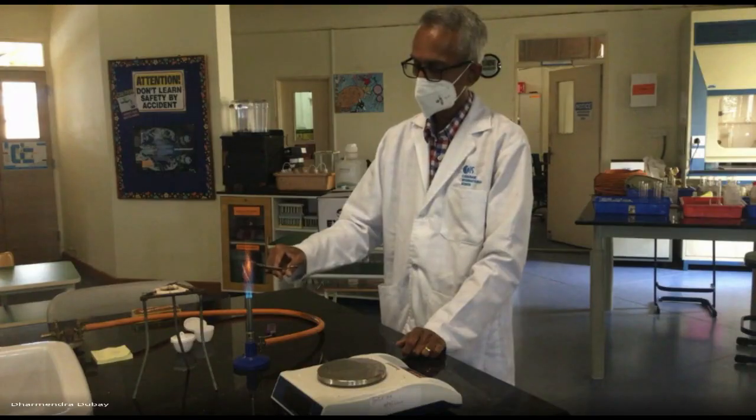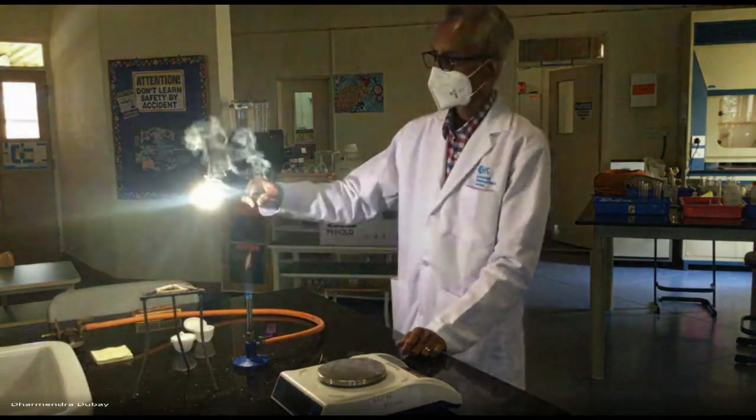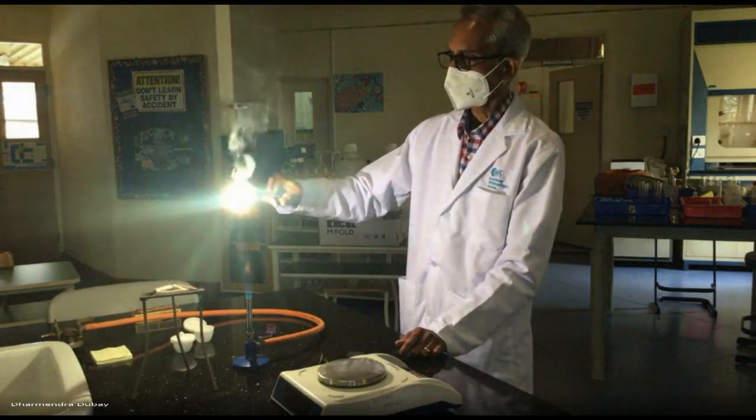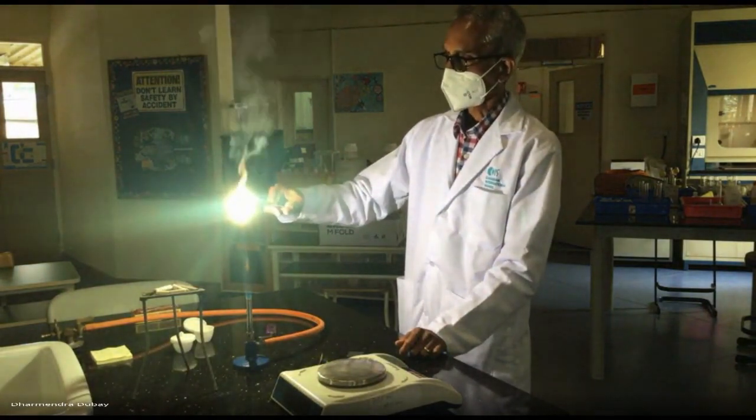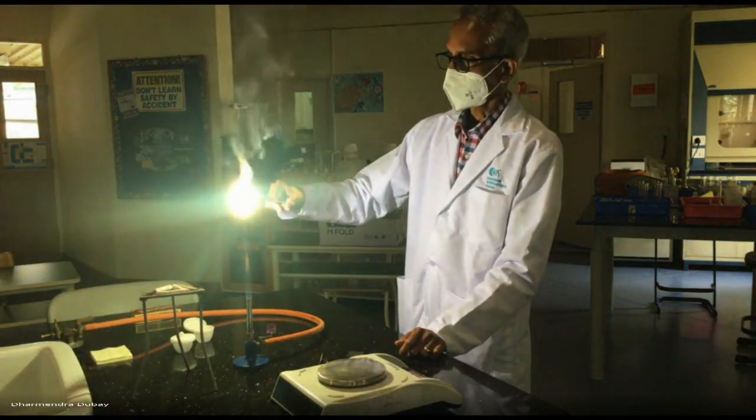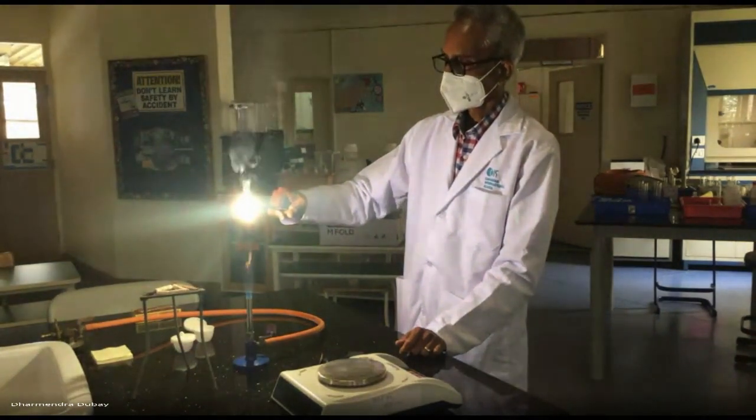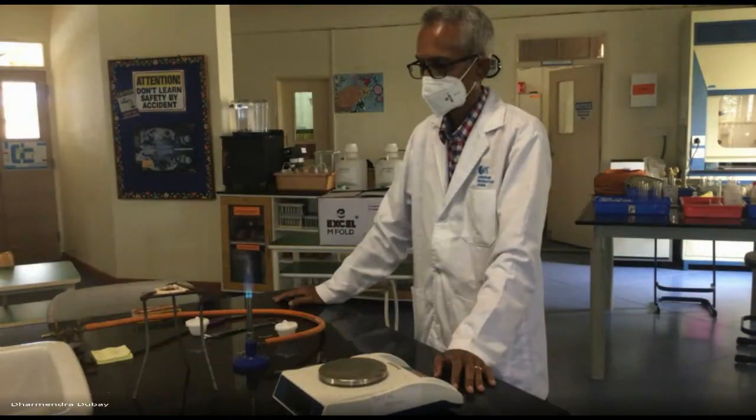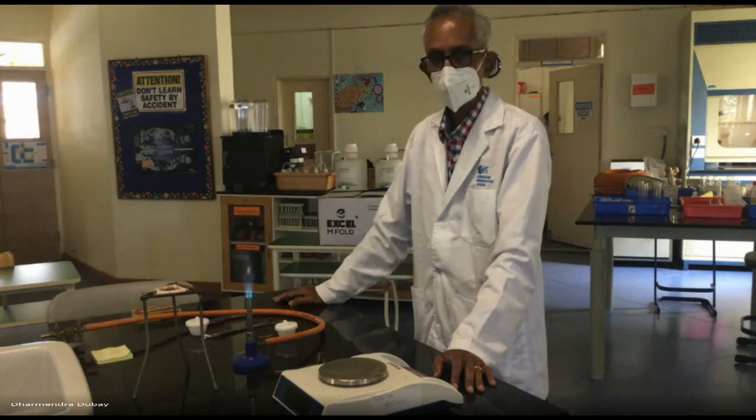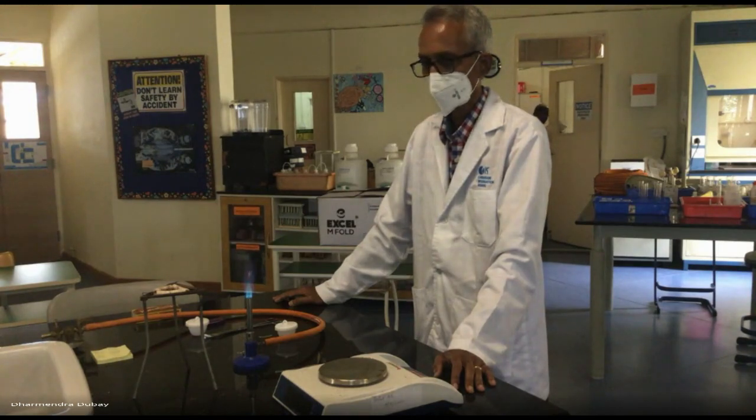There was a lot of smoke coming from it. Well, there was a lot of smoke. And that is going to carry, maybe not a whole lot, but some particulates of the magnesium oxide. It will be hot, then it will go into the air. So, it's just one strip that we are burning, but one small piece. And if that carries a small piece of mass with it into the air, then that's lost.